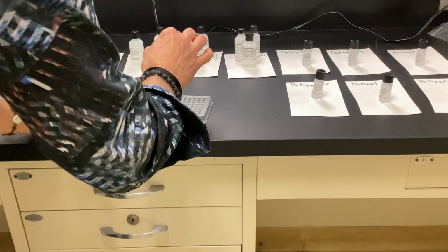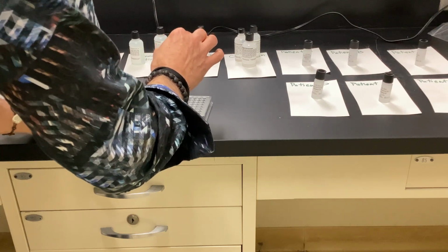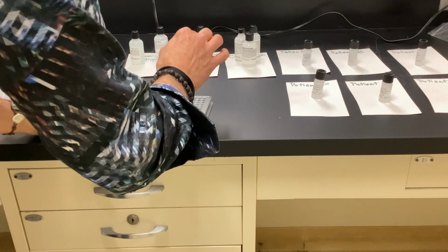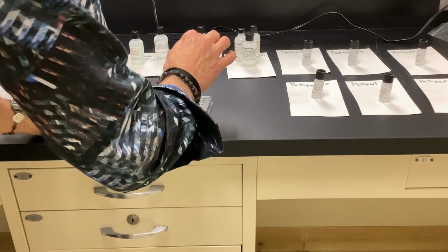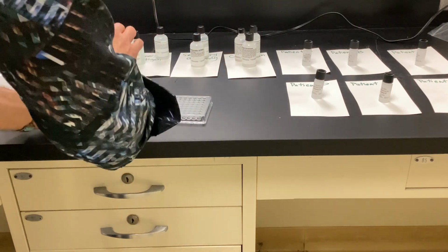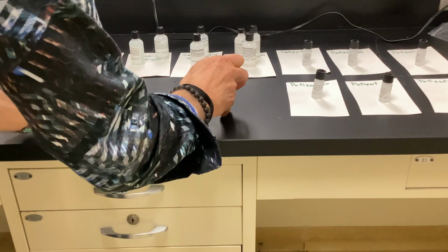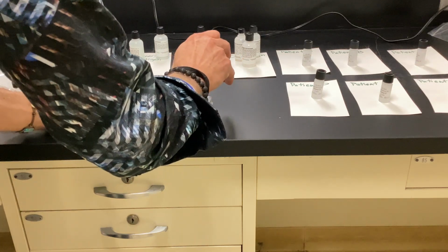All right, so I'm going to put the antigen in each one of the wells, 3 drops. All right, in real life, we would rinse these between each. So if something didn't bind to the antigen, we'd flush it out. But for this lab, it's a simulation. And we're not doing direct, we're doing indirect.